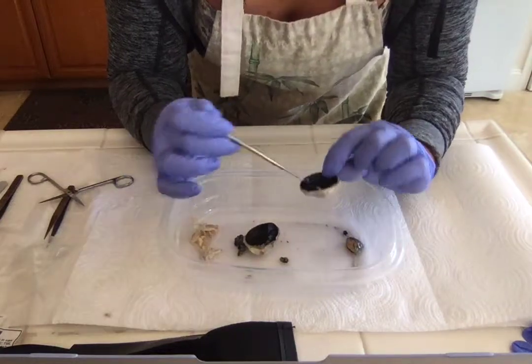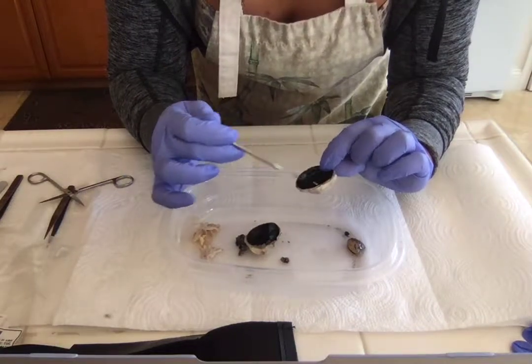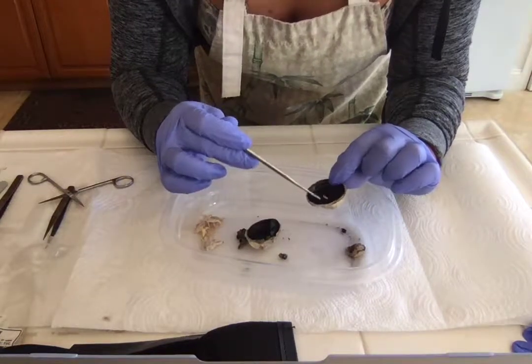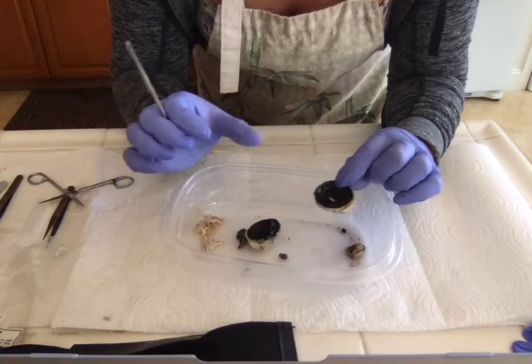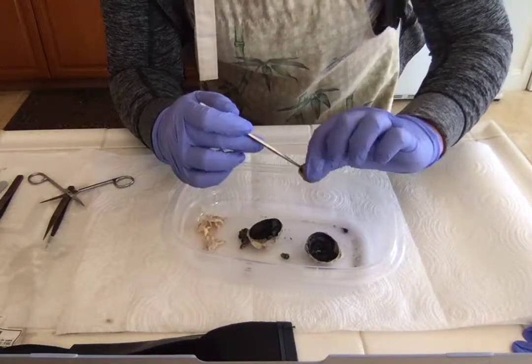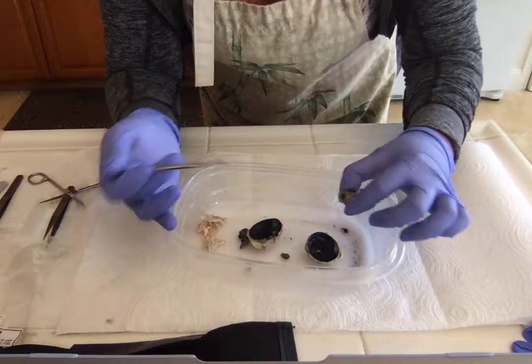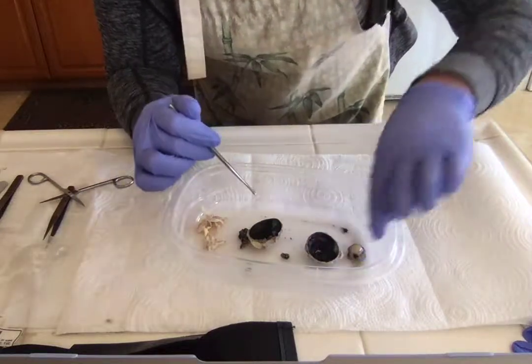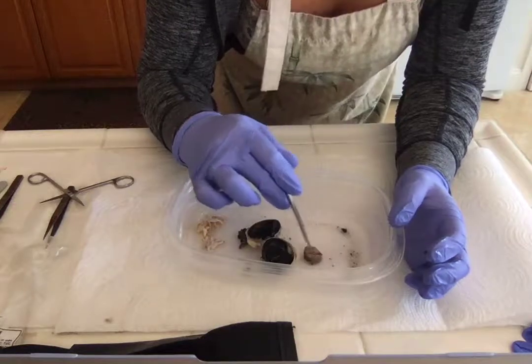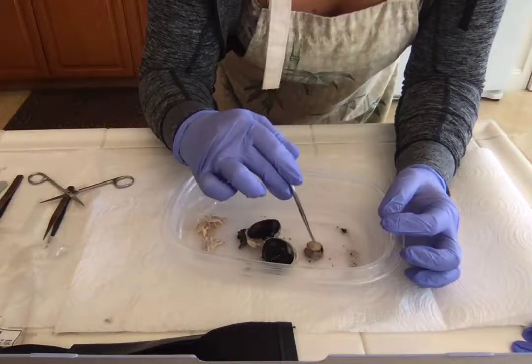our eye colors. But the difference between what constricts the lens and the actual iris, which opens and closes, known as dilation, to allow a certain amount of light into the eye in order to hit the retina and then interpret information. So this part was also really cool to me, the lens.